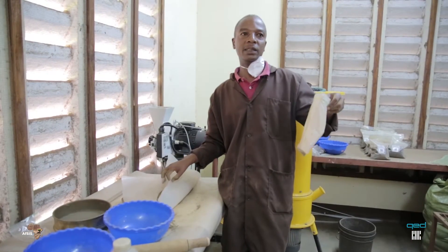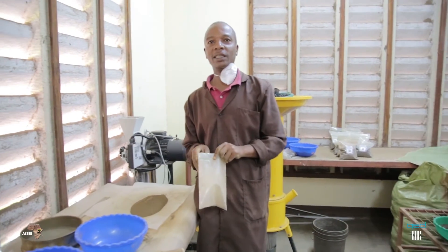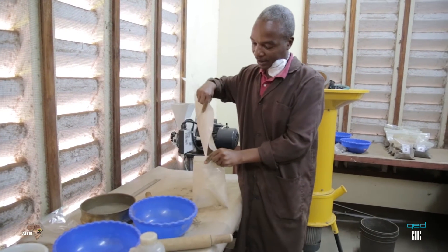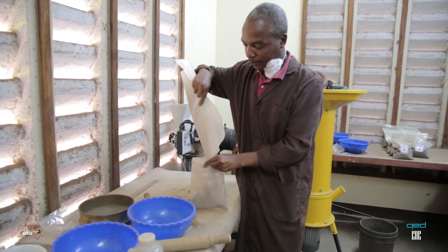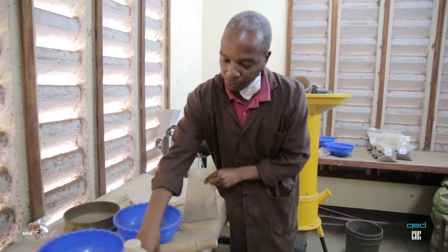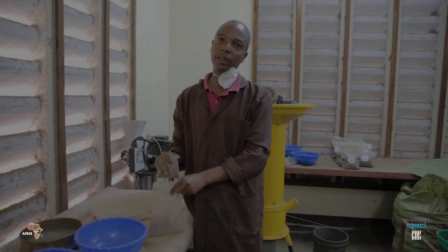And the remaining portion, we are putting it in the store at the back because we are not throwing anything here. And because the fragment we have, it should be kept in the original sample — the final sample. Thank you.